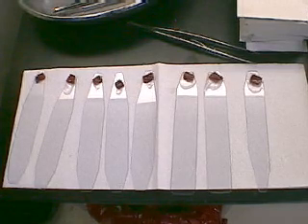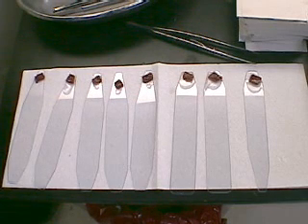This shows the tissue lined up on what I like to call my launch pad. I'll be able to grab the tissue in order — I keep them numbered 1 through 8 so that I'll be able to remember what order my specimens are in.